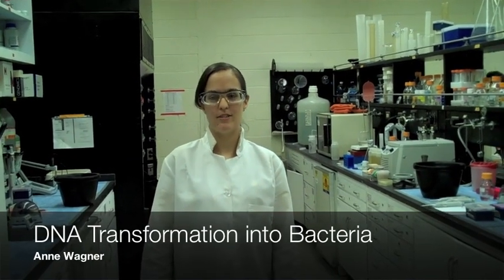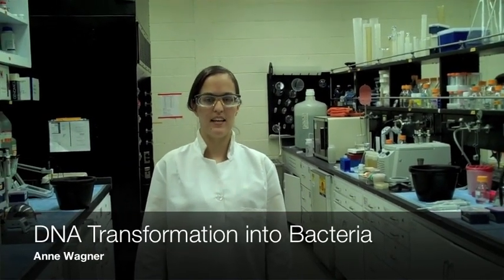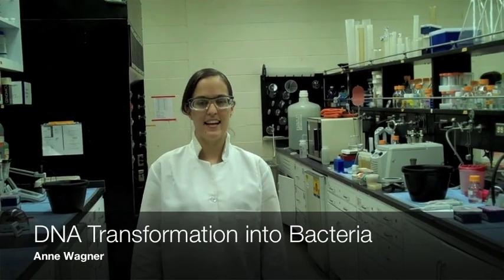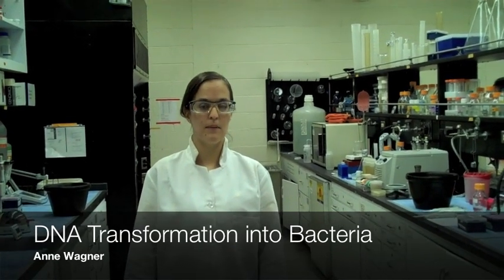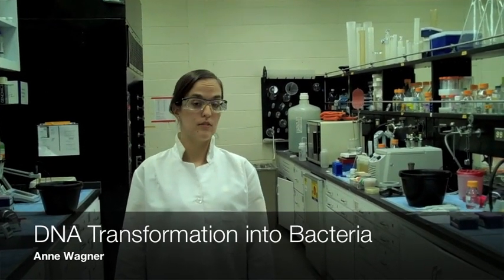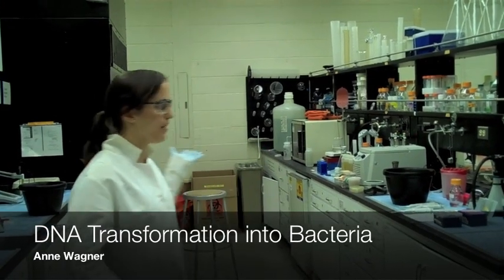Hi, my name is Anne. I'm a graduate student at the University of Pennsylvania and I work for Dr. Peterson. Today I'm going to talk to you about the molecular biology technique called bacterial transformation in our molecular bio labs.